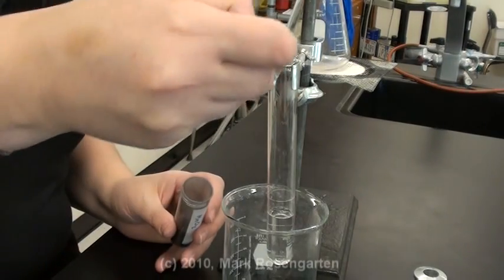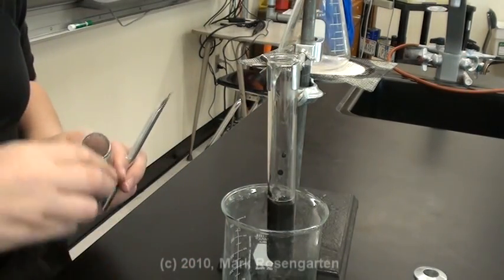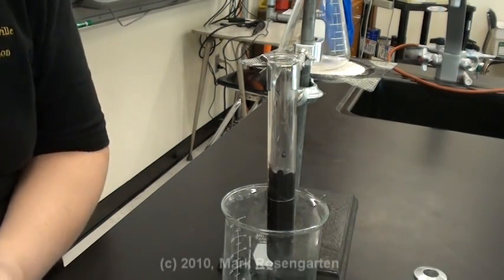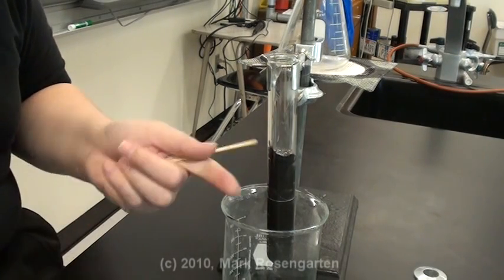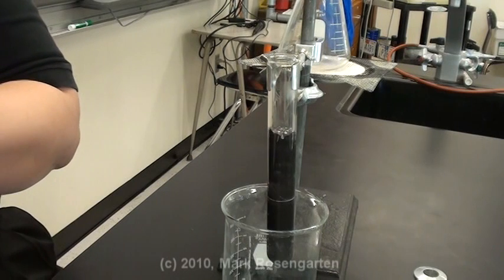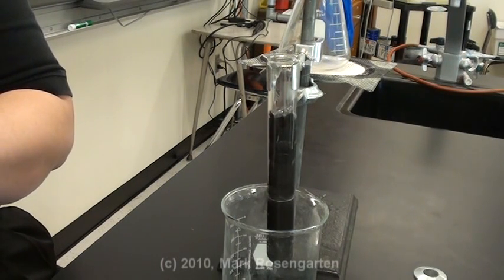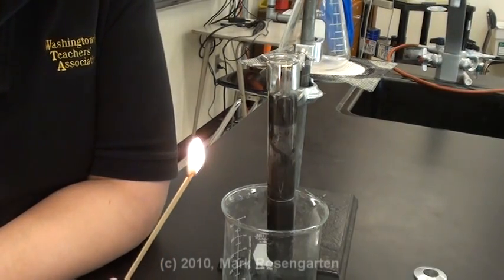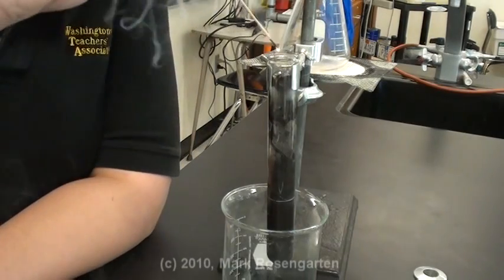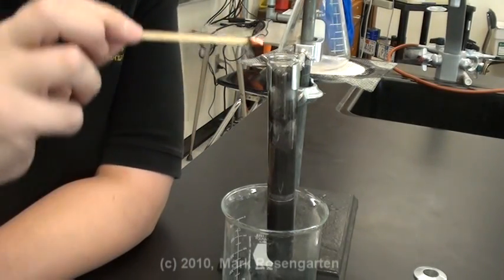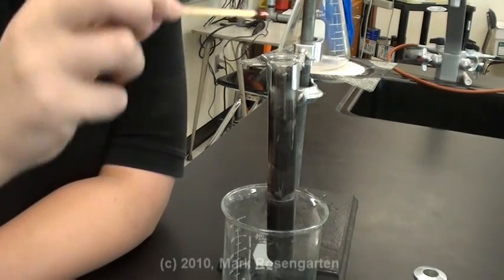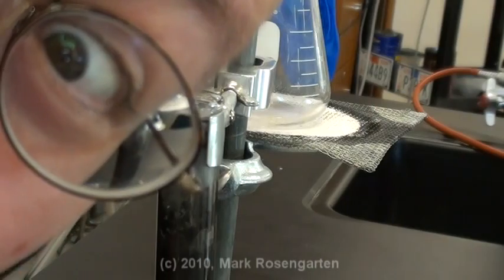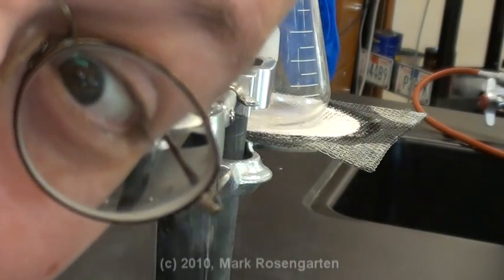Here goes the catalyst. Well, some kind of gas is being formed. It's forcing all this upwards. What gas is it? The glowing splint test shows us pretty definitively that it's oxygen.